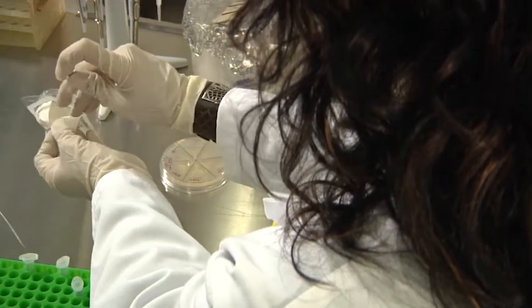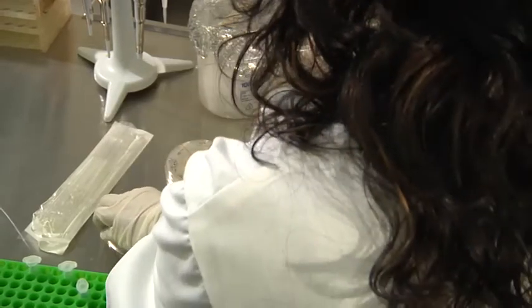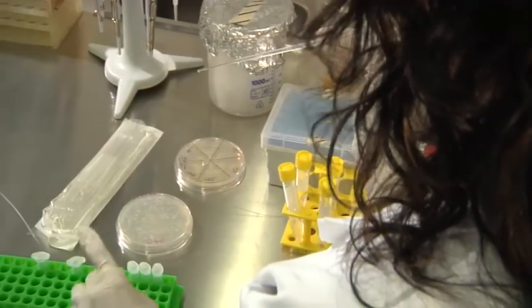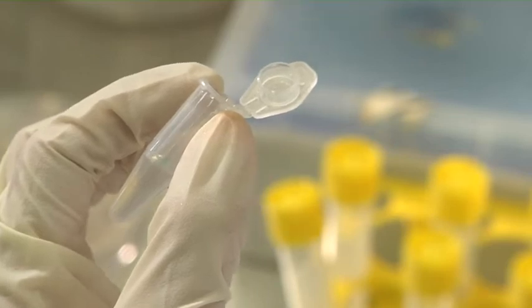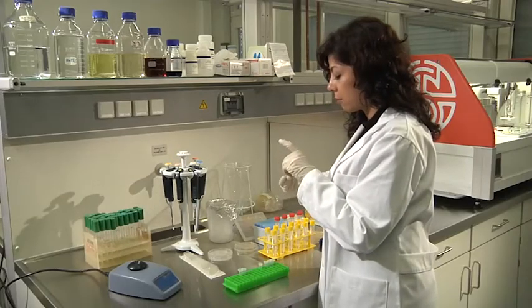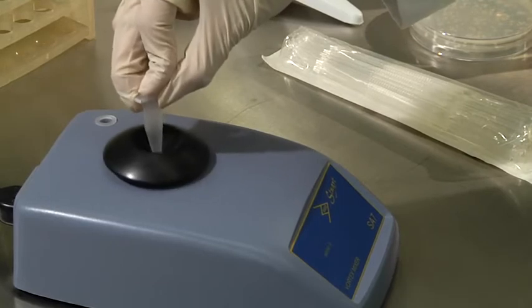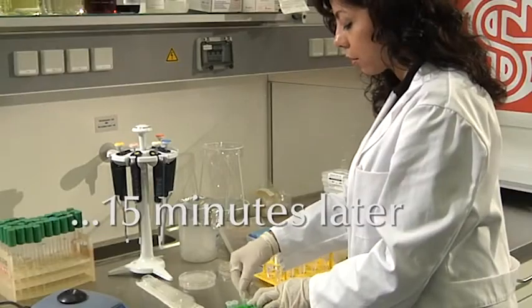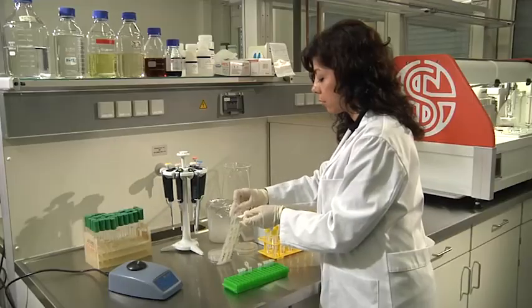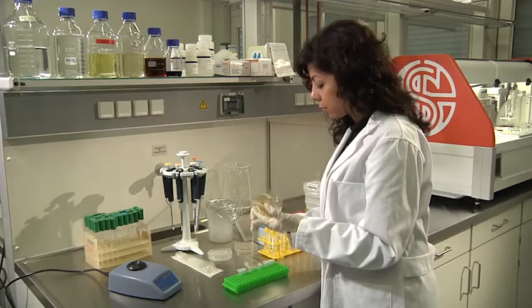We can transfer one single colony by using a sterile inoculation loop. The cell material is diluted. To optimize the dispersion, the tube is shaken by a vortex machine. With the help of a new inoculation loop, we take out some diluted cell material and streak it out on a fresh agar plate using a standardized method.